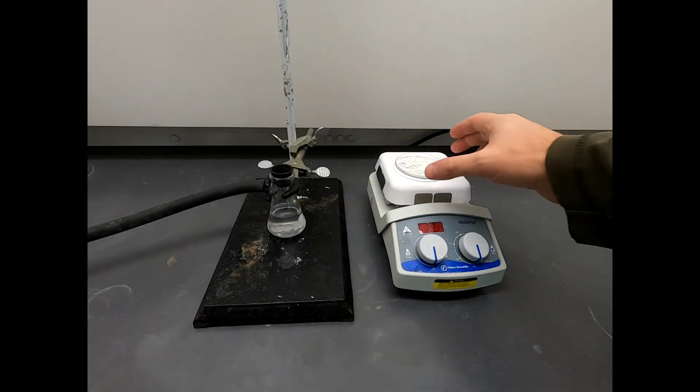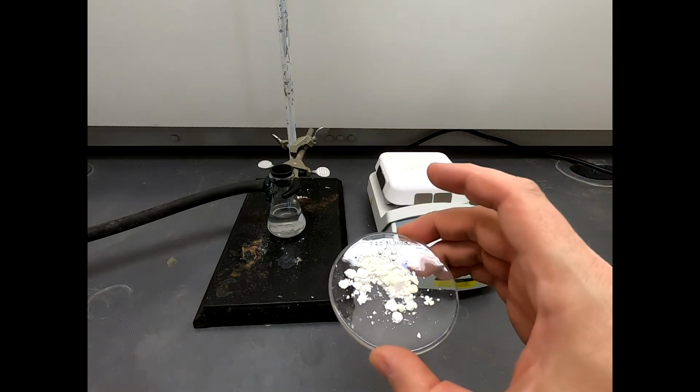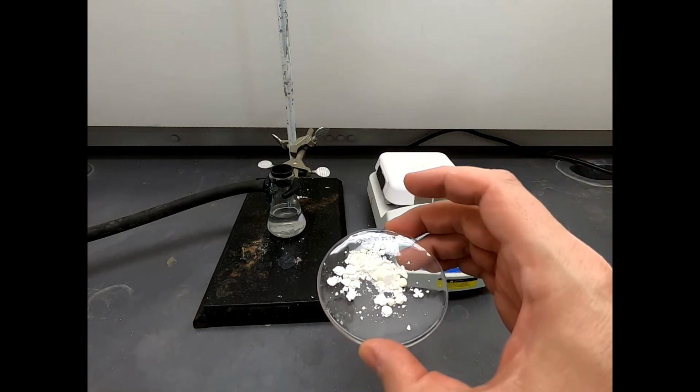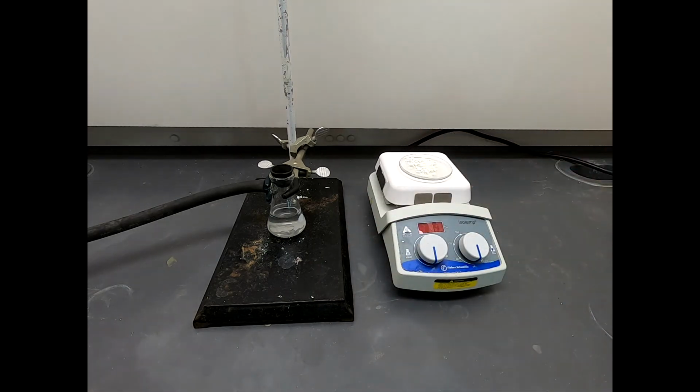Well, our product is nice and dry a day later. Here it is. That's a net mass of 1.22 grams. It's 1.22 grams of what is presumably the benzoin acetate. So that's our recovered mass. Ultimately we'll need to calculate a yield on that, but for now, let's make sure that this is fairly high purity material.